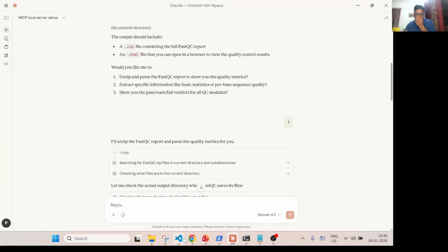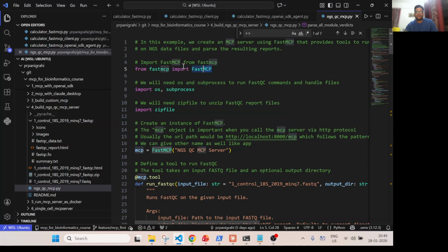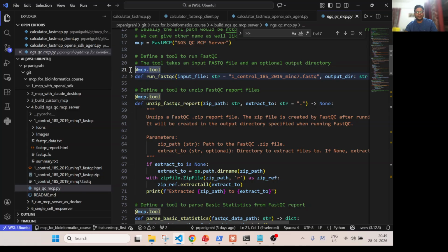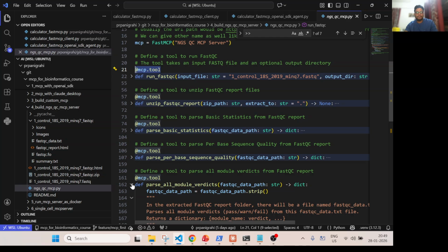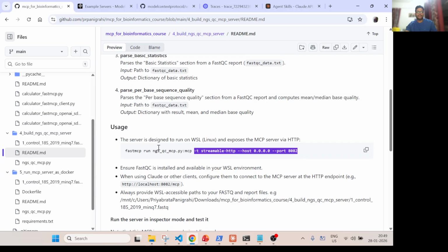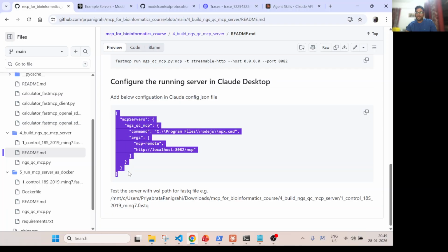So in short, the code is very simple. Okay, I'll just quickly summarize. Just import the package and all the modules, define a Python function and decorate it. Okay, and then run the server using fastmcp run, right? This is what I have documented here in the code as well. So you run it, then configure your Claude Desktop and it will work.